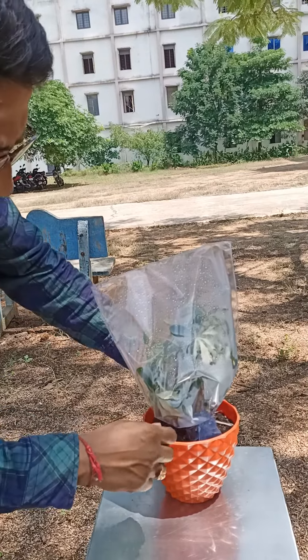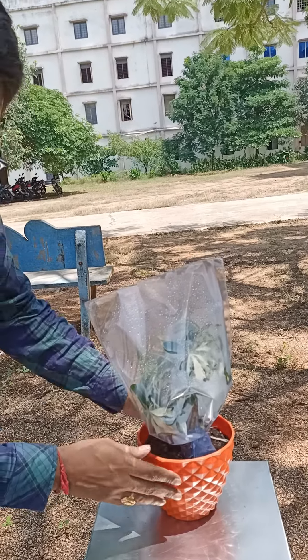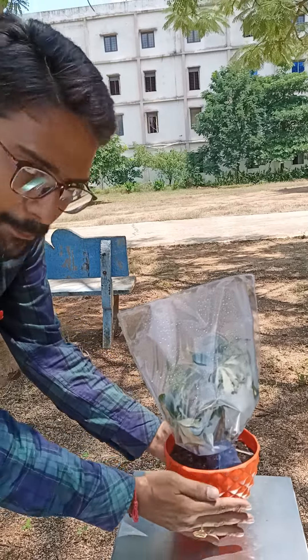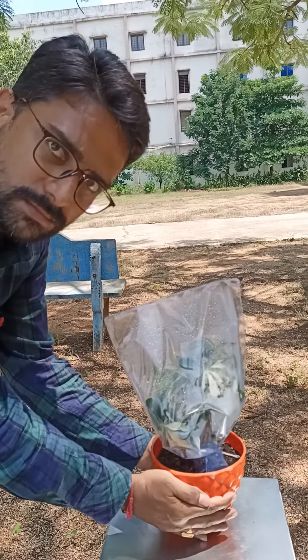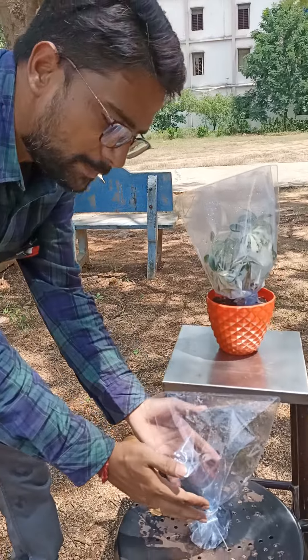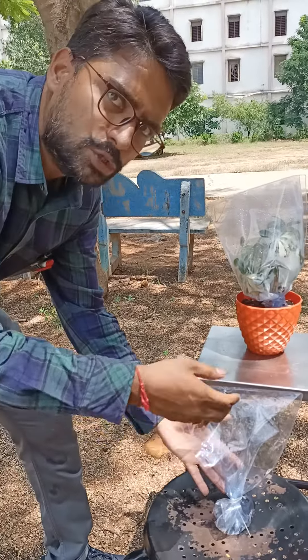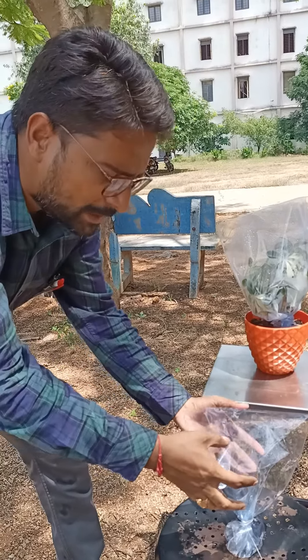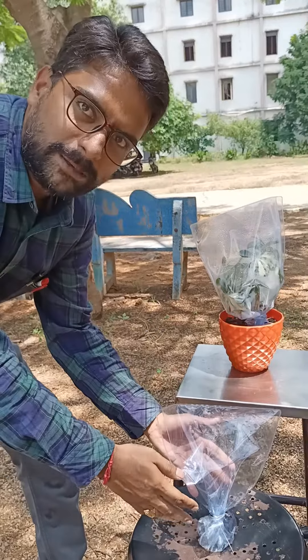With that thread I tied this polythene bag to the plant and I placed setup 1 under sunlight for 2 hours. The same thing is done to setup 2 as well, but here there is no plant, there is no pot — just a polythene bag tied with a thread.